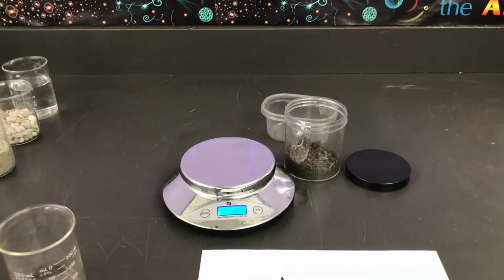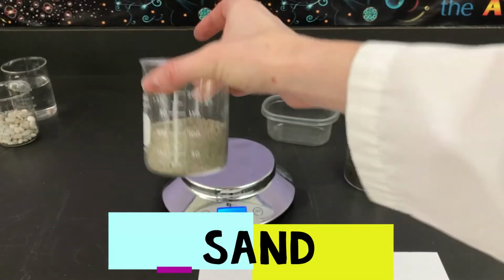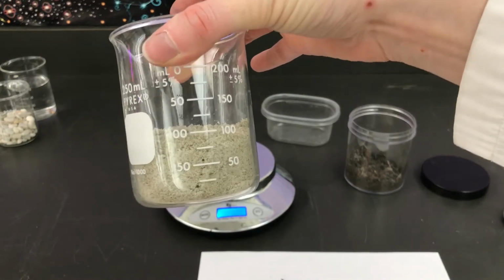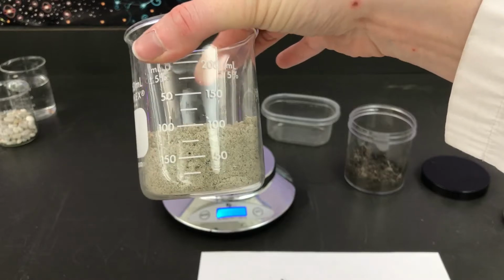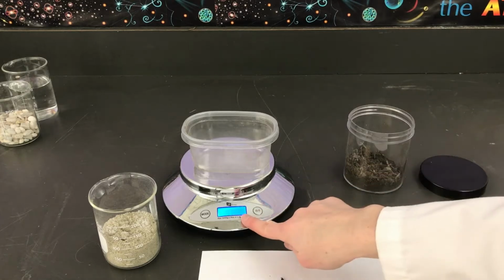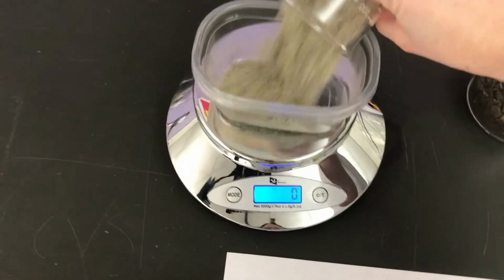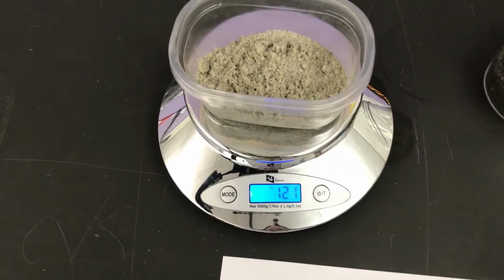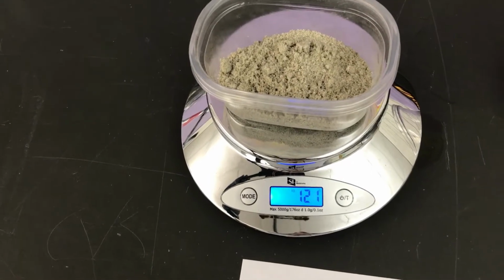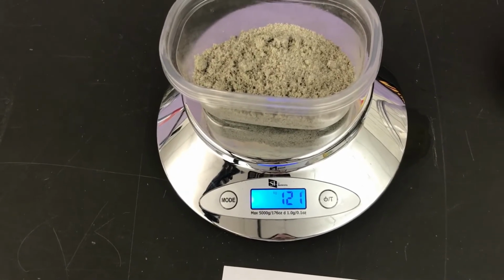Okay, let's do our next substance. Our next substance is sand. We have some sand, and you can see that I have also measured out the volume is 100 milliliters. Again, to get the mass, we're going to zero out our scale and measure that sand. The sand is 121 grams according to the scale. So the volume was 100 milliliters and the mass is 121 grams.